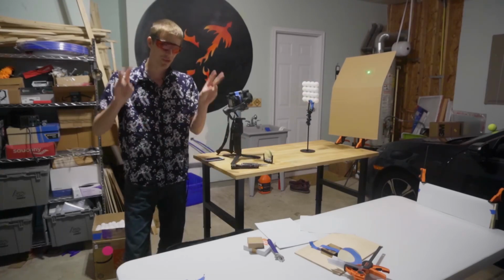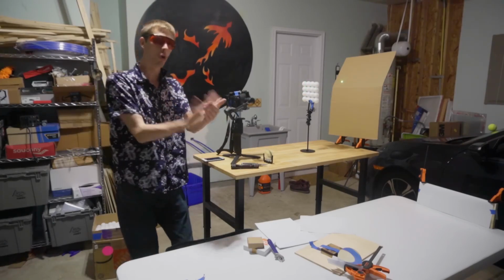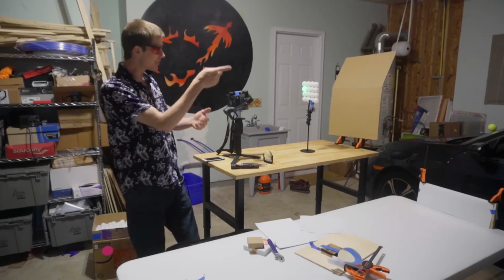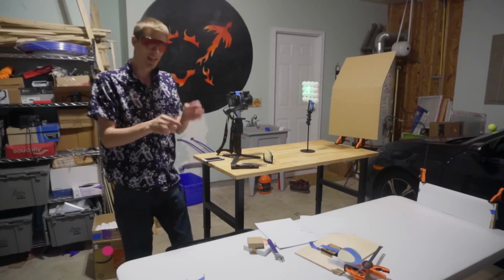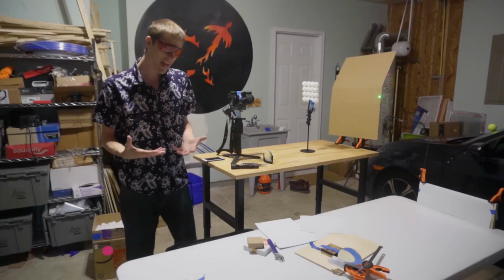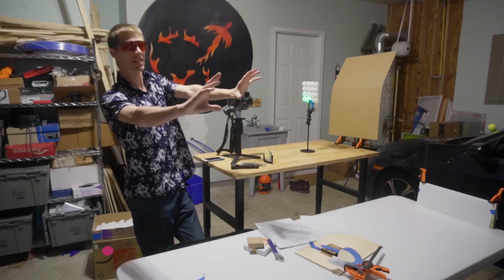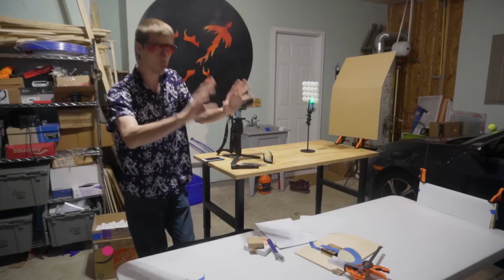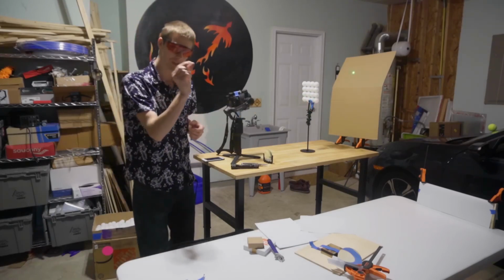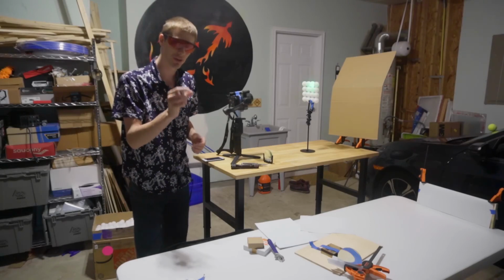So what does it mean to scan an image? Basically, instead of taking the whole image at once, you're rastering the beam back and forth, taking the image 1 pixel at a time. And in order to do that, the electron beam isn't a parallel beam that covers the entire sample, illuminating it at once. You actually focus the beam down to a point that is smaller than an atom.